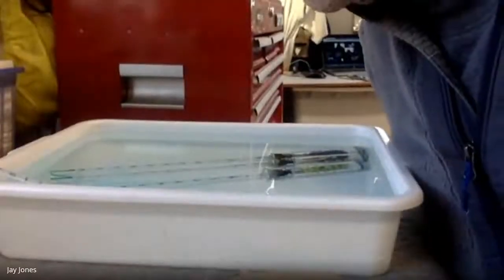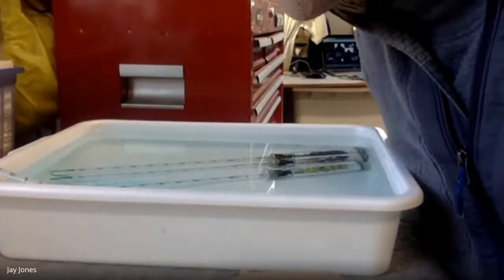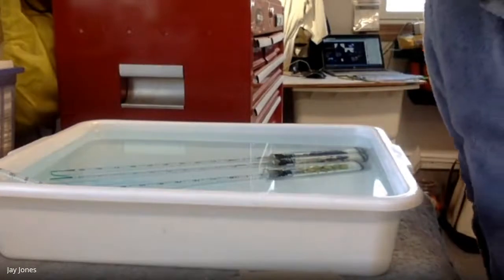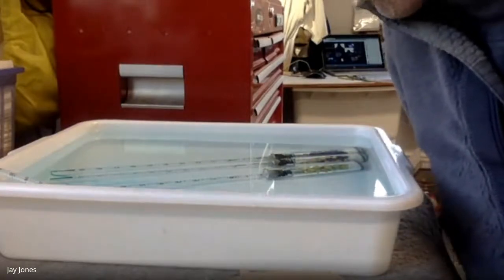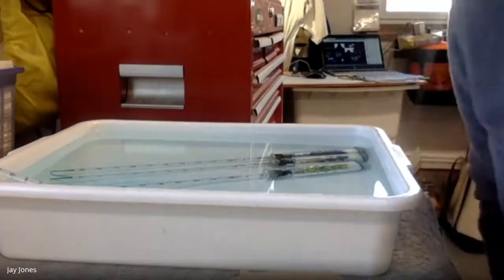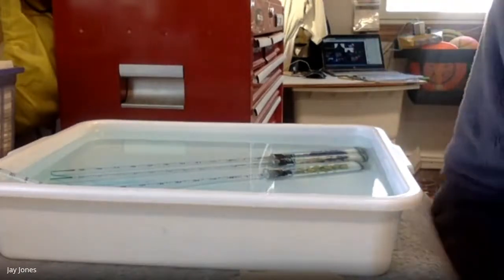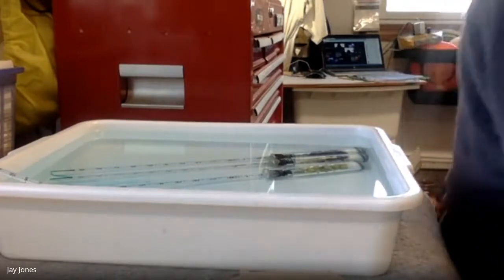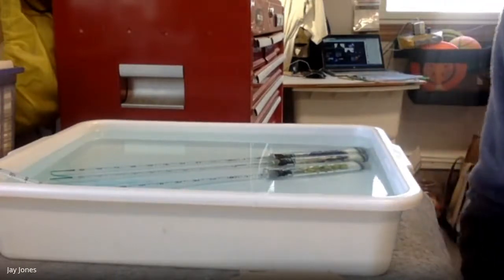I'll stop it. All right, Shreya, we're looking at 0.77 for germ, 0.77 for germ, 0.93 for dry, 0.92 for beads. Good? Yeah, I got it. All right, 55 we go, 55, 11:55.